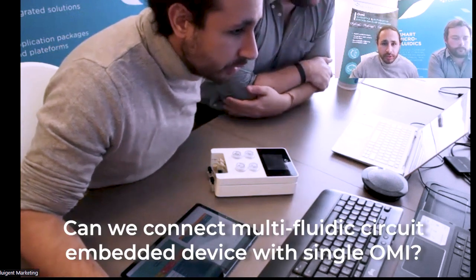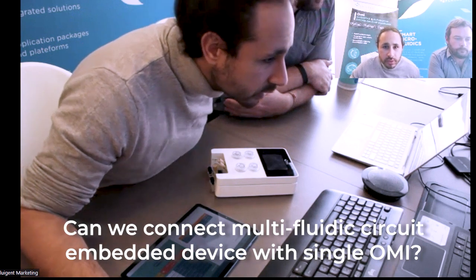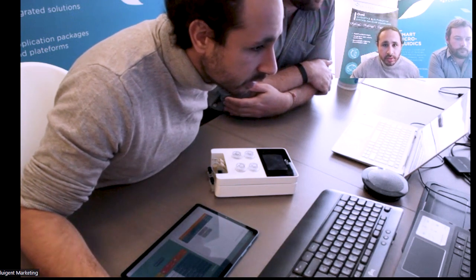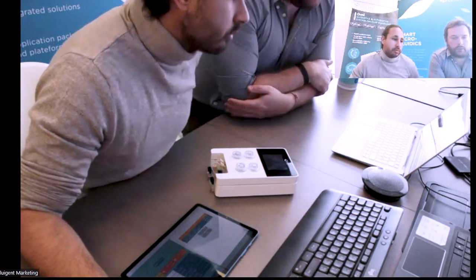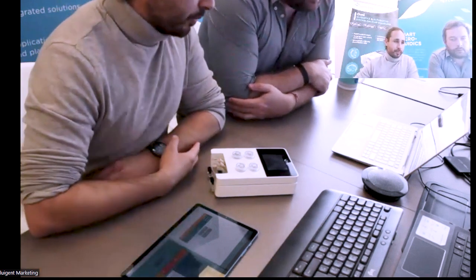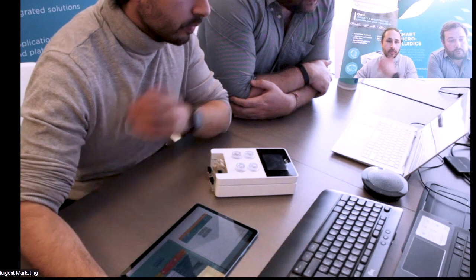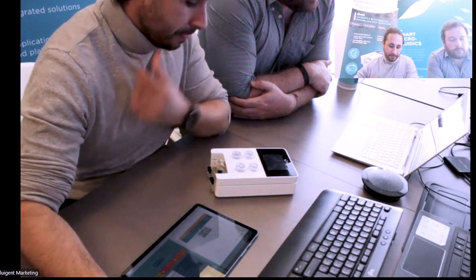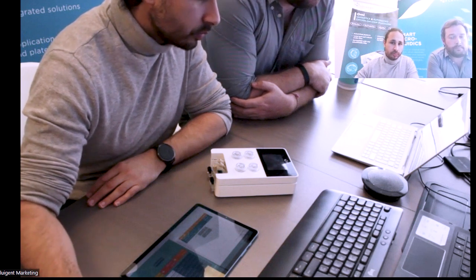Can we connect a multi-fluidic circuit embedded device with a single OMI? I think in parallel connection, for the same fluidic circuit in a single device, can we control that device using a single OMI? Yeah, so you could imagine having a T where you can connect all those 4 chips to the single output outlet of OMI. The only thing is that OMI will control the total flow rate.